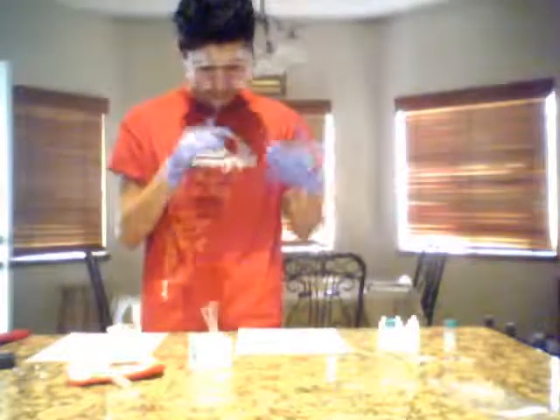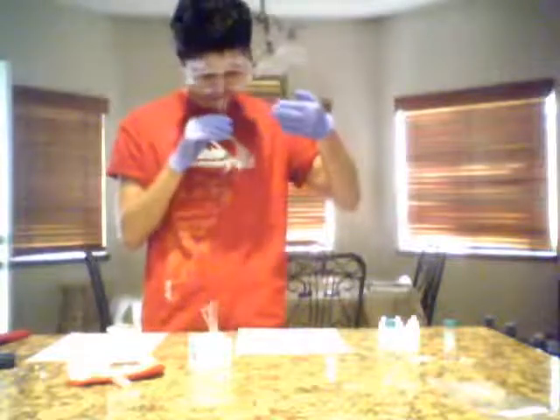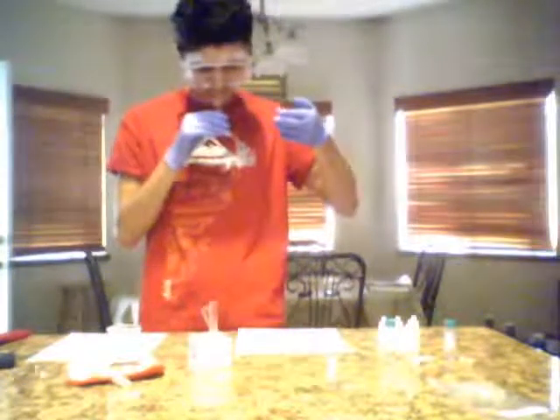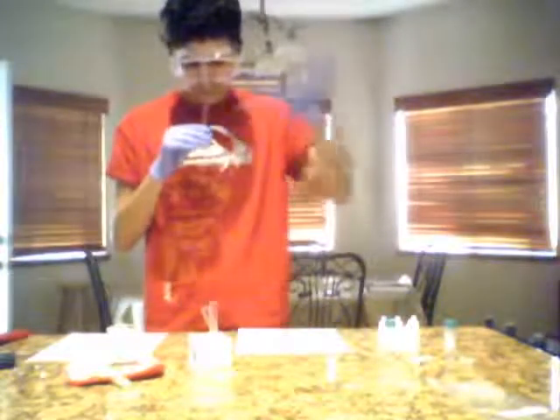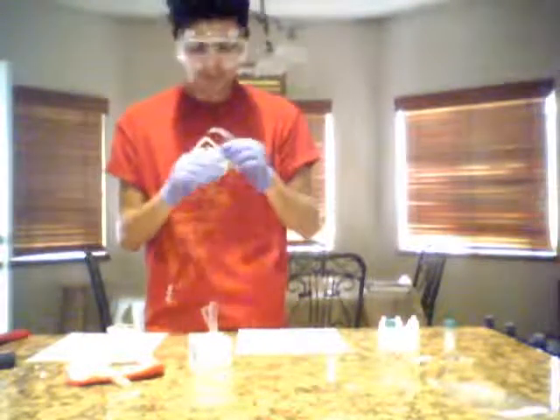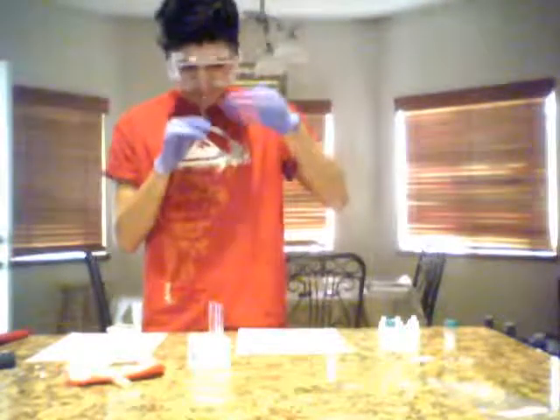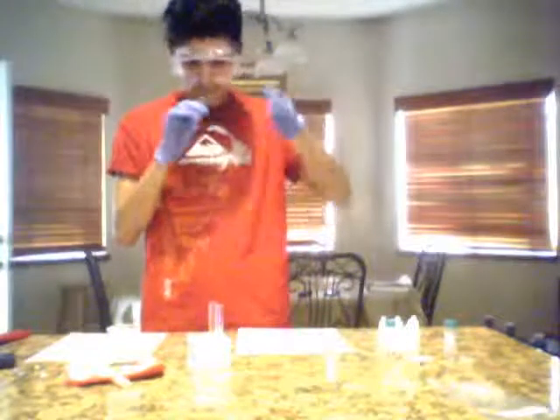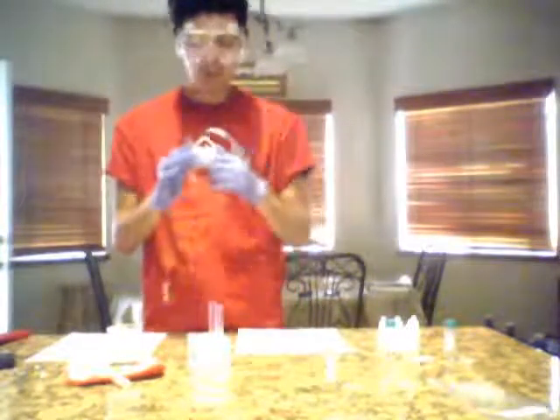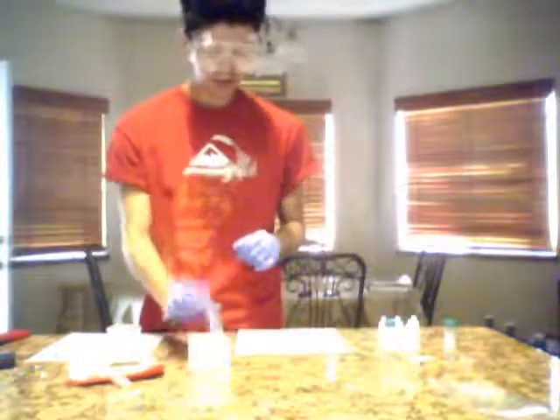I can't really tell on this one. It kind of smells a little vinegary, almost like an acetone to me. Okay, so number 2. Oh wait, this one smells more like an acetone. Like what you would smell when you walk into a nail salon, when the ladies just have their nails just done.